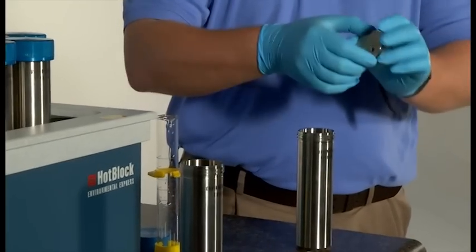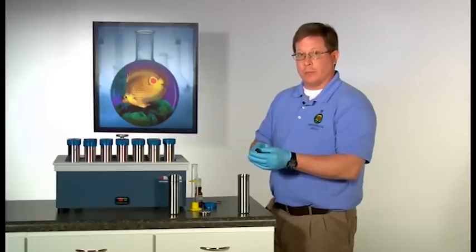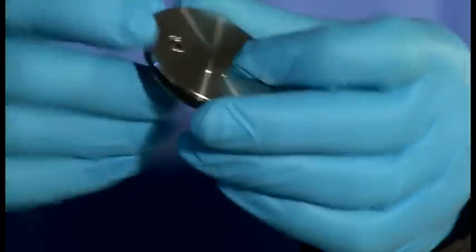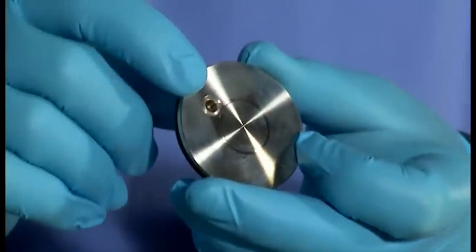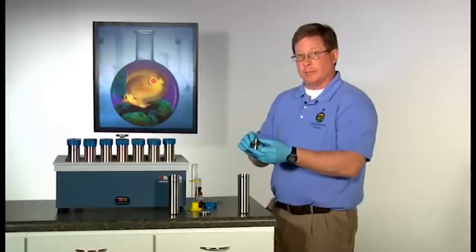Place the stainless steel inner lid on top of the soil cell. The O-ring provides the tight seal with the soil cell itself and the rupture seal provides a safety mechanism in case there's an unforeseen pressure increase due to an unknown in a sample.